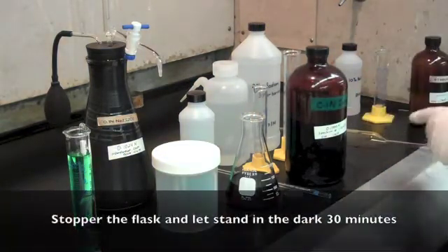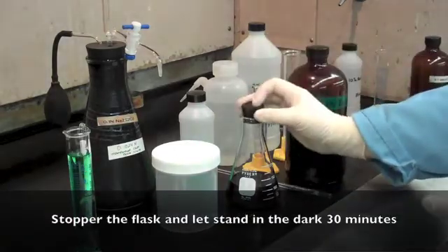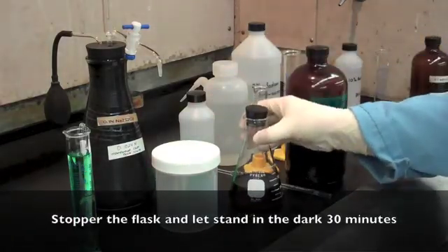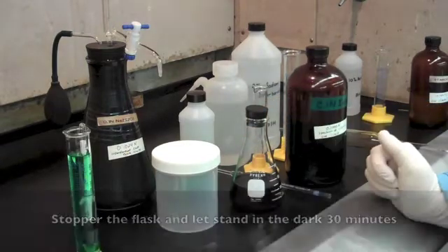We will stopper the solution, and we're going to put it in the dark, either in a dark drawer or a dark cabinet, for 30 minutes.